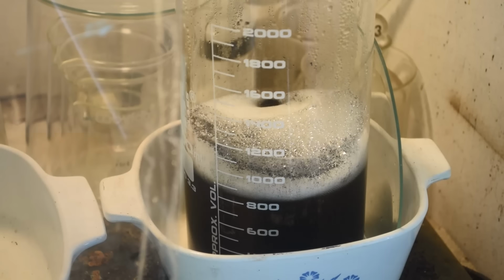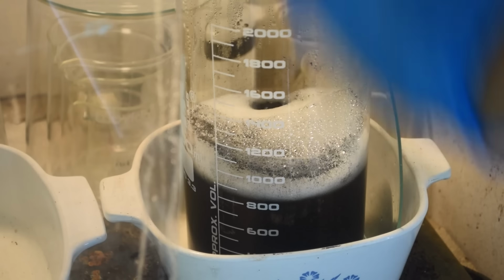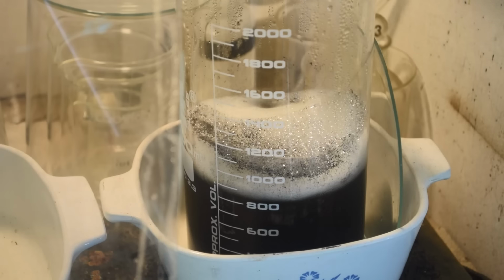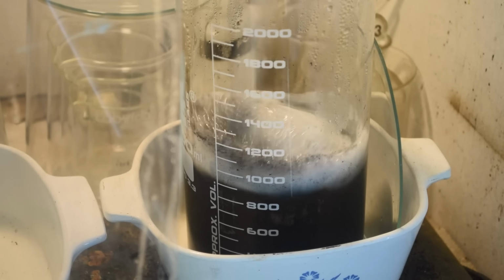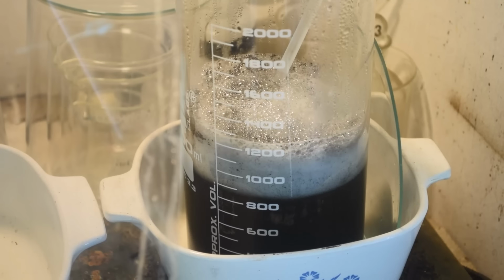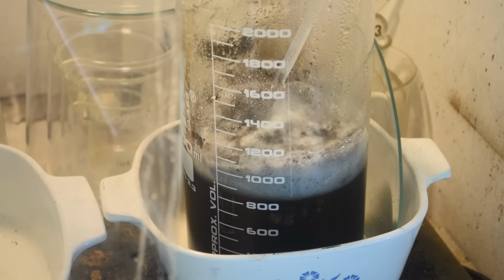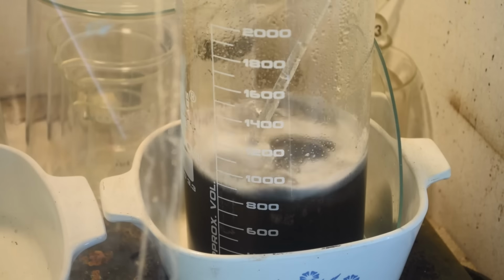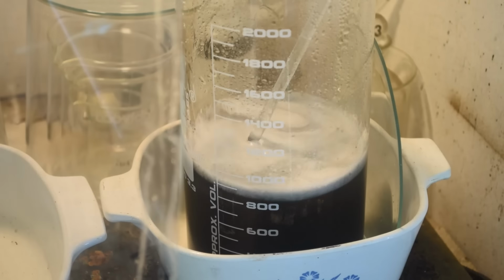All right, it's been a couple minutes. This stuff's just starting to come up to a boil. Look at the black. The black powder in the foam right there. I would say that is palladium metal. Uh-oh. It looks like it wants to foam up. See if I can beat the foam down here.